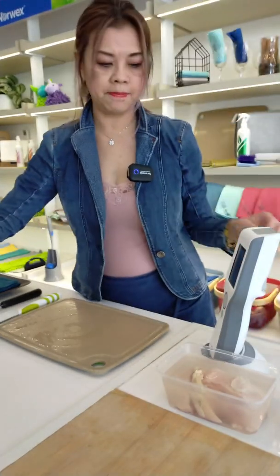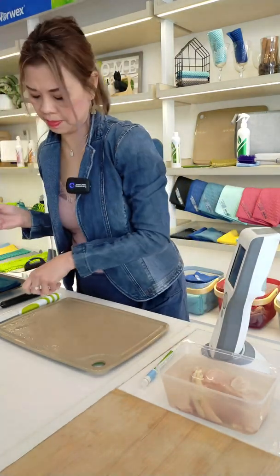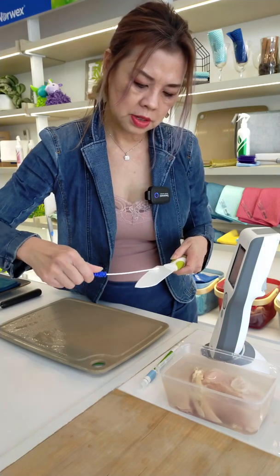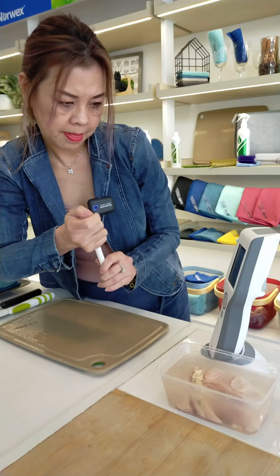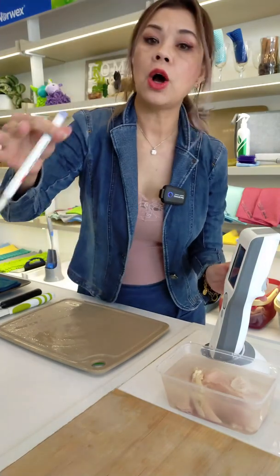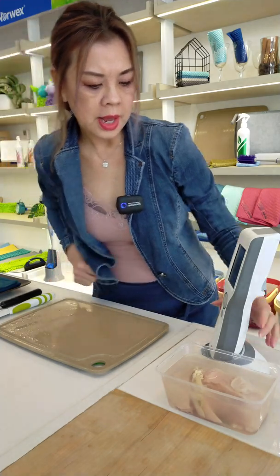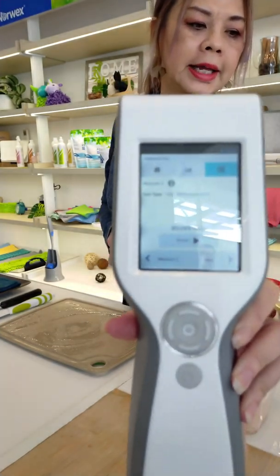Now I'm going to do it on the ceramic knife. I'm going to swab this side, counting off the swab strokes. On the ceramic knife, let's see how much RLU is picked up. It's 80,389 — not as high as the stainless steel, which had a six-digit reading.